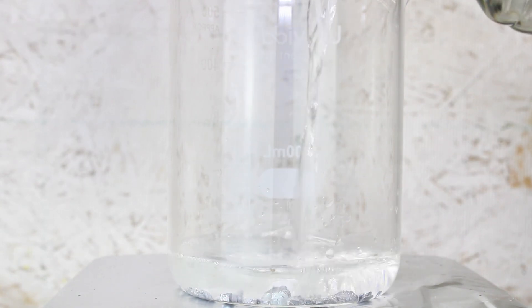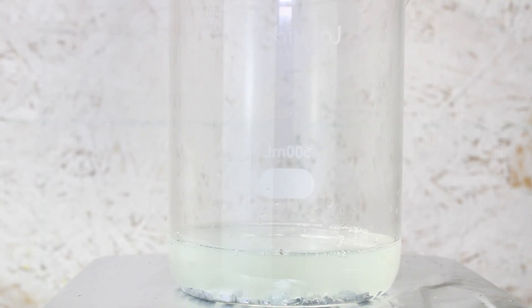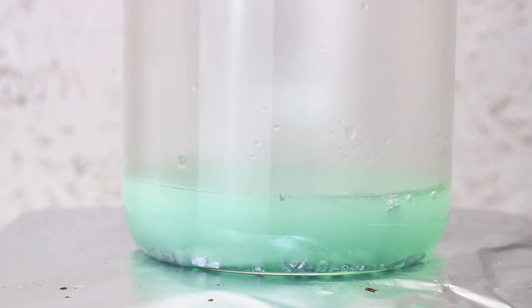Now to get started, the first thing I needed to do was to dissolve some chromium metal in hydrochloric acid. Now I happen to have pure chromium metal, but most people don't. However, it's pretty accessible and there's a few ways to get it.